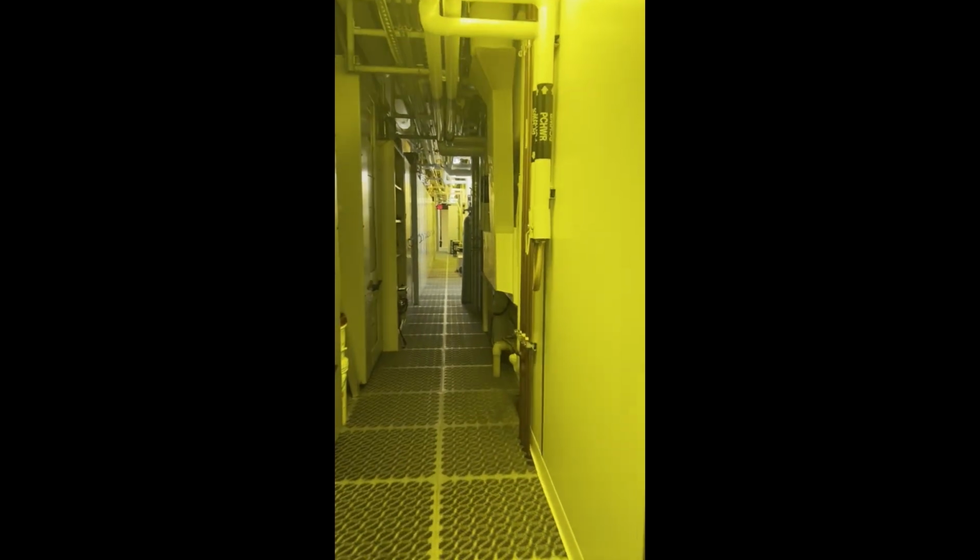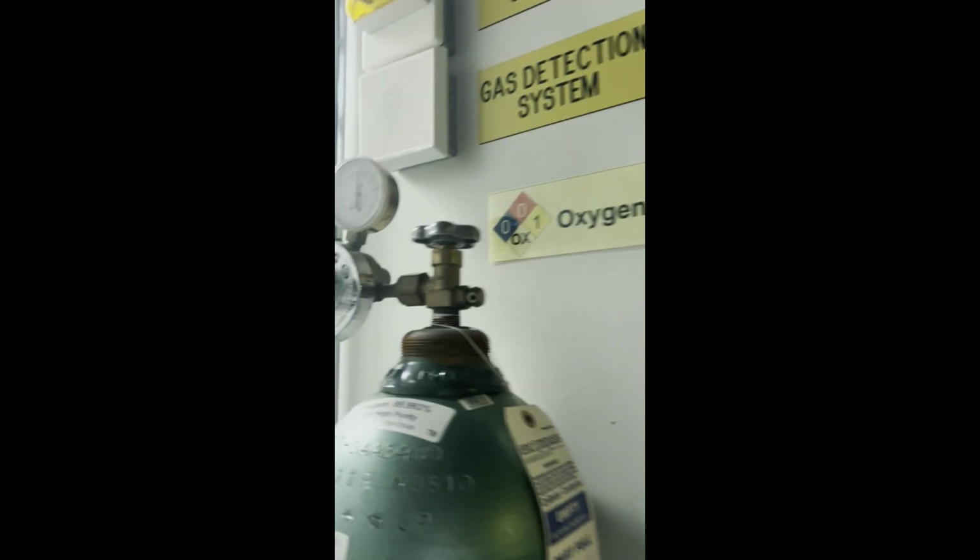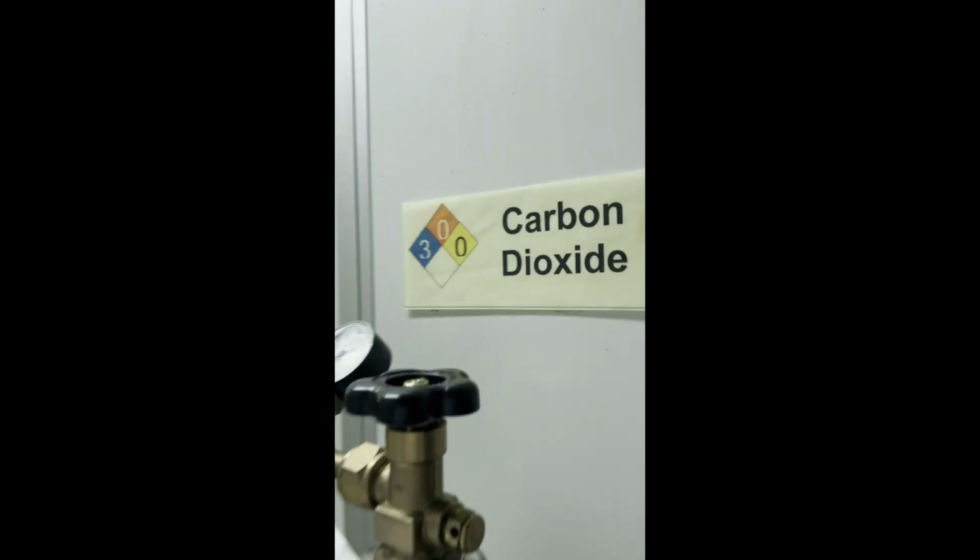So before you start your plasma etching or start using the machine, you're going to want to go into the back side of the lab, which is the hallway behind the hybrids lab, which houses a lot of the extra materials. You're going to open up the oxygen and the carbon dioxide tanks.